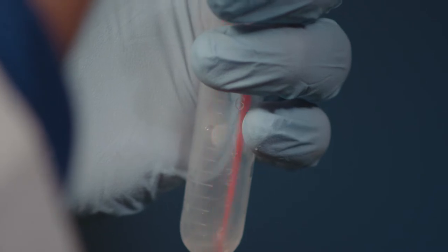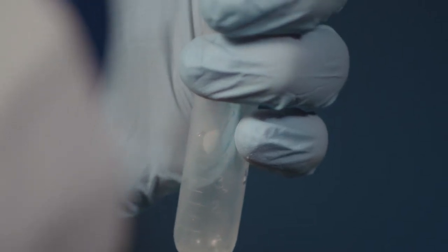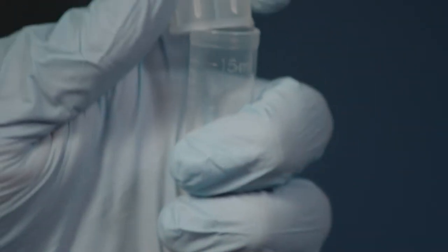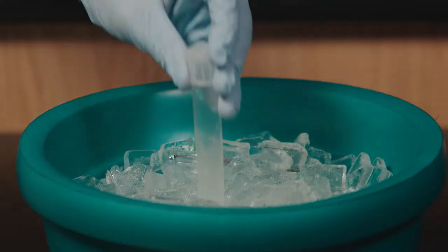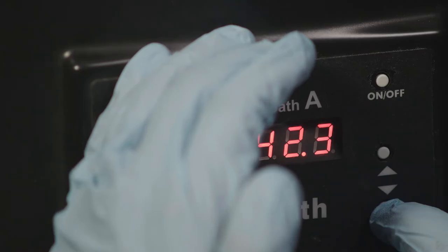Next, transfer the plasmid DNA to the tube. Place tube on ice and set your water bath to 42 degrees Celsius.